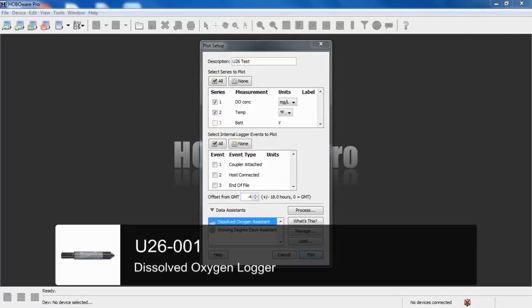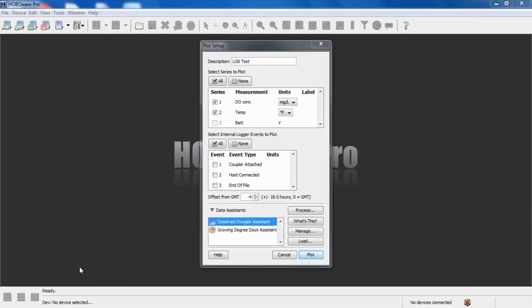Again, if you are in a saltwater type application, you can adjust the data for changing salinities. You can also put in a barometric pressure, either a value or use a barometric pressure data file to calculate percent saturation. So what we have here is a data file we've offloaded from our U26 dissolved oxygen logger, and we're going to run through the Dissolved Oxygen Assistant for you.